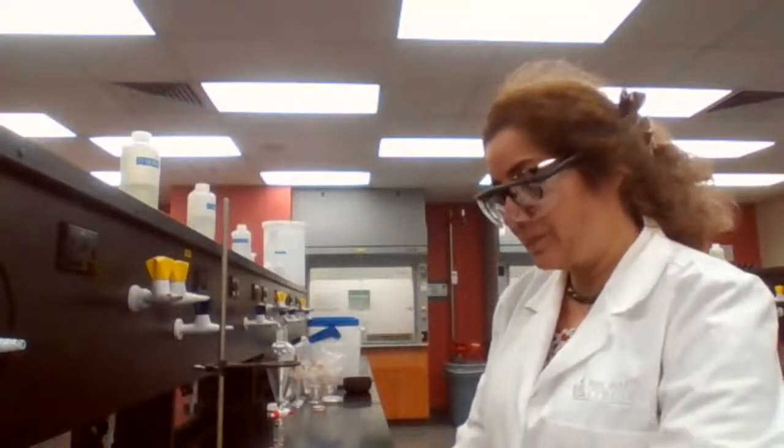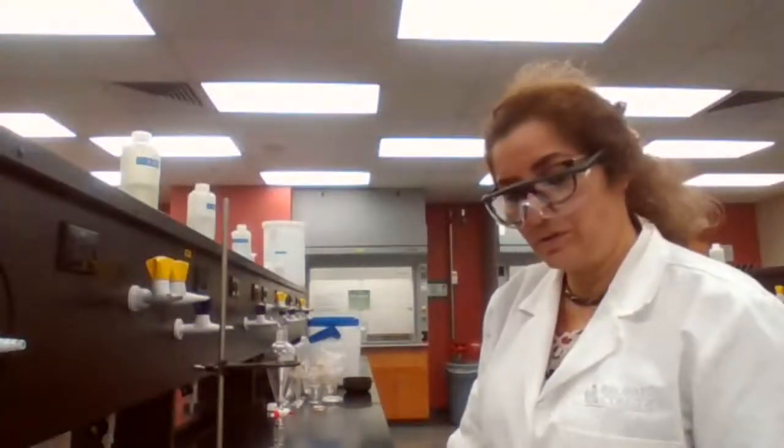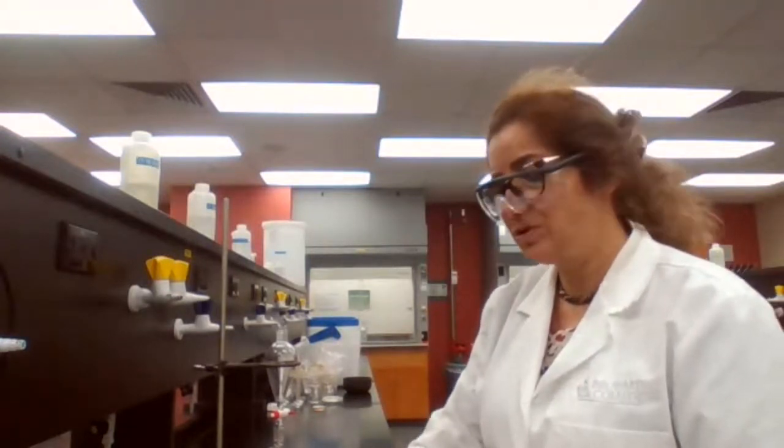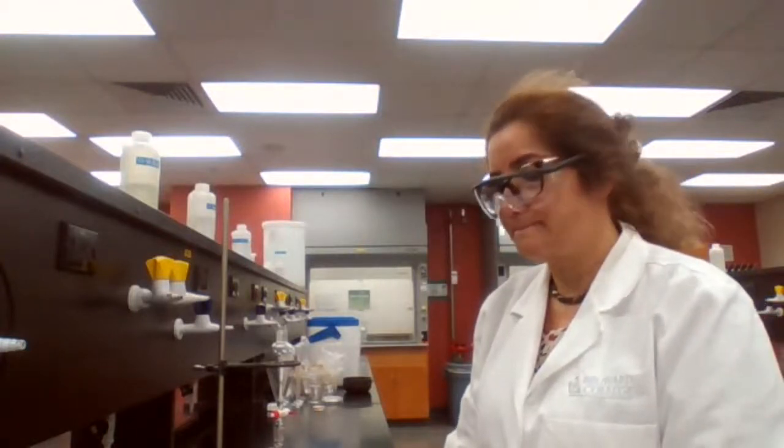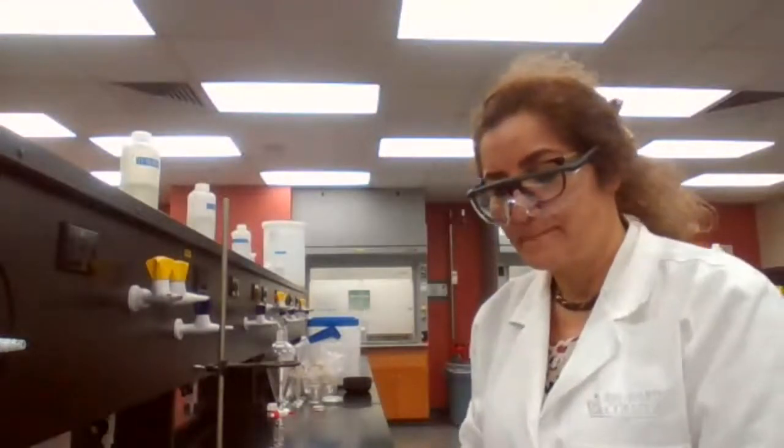I'm going to go ahead and start the experiment. You help me start the experiment. Go to the procedure and tell me what to do first. And can you tell me what is the characteristic of the extracting solvent? How should the extracting solvent be? Can we use ethanol as extracting solvent? No, why not?